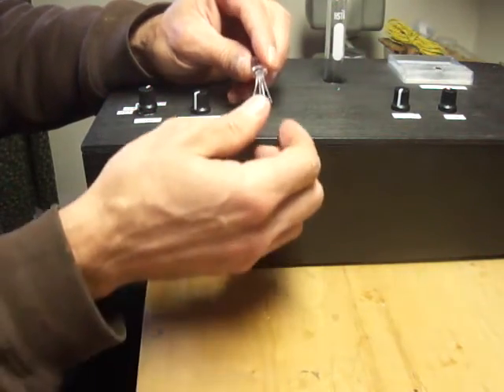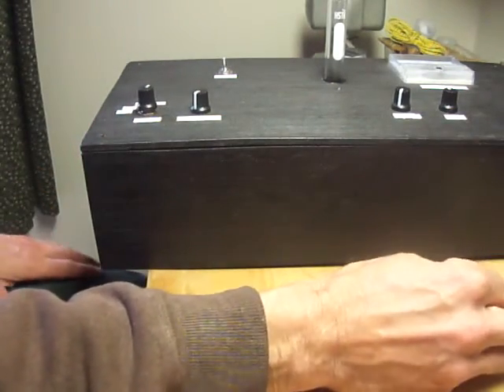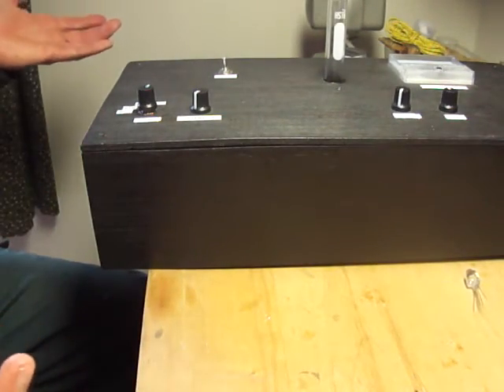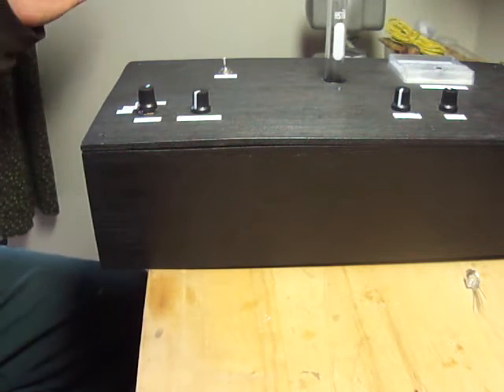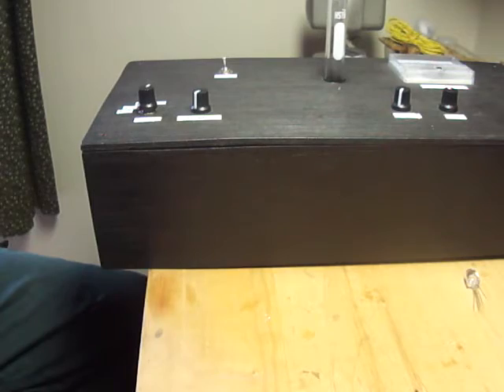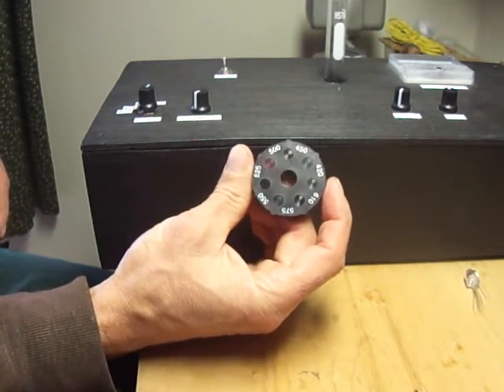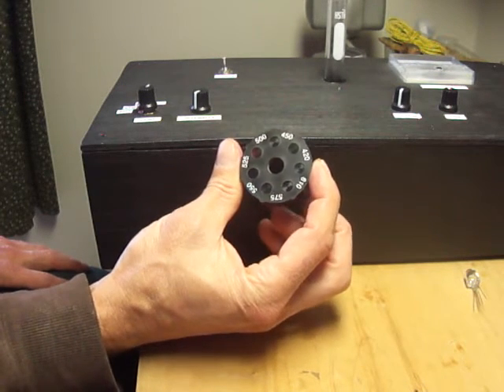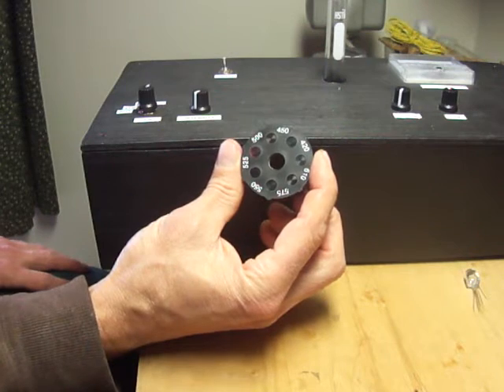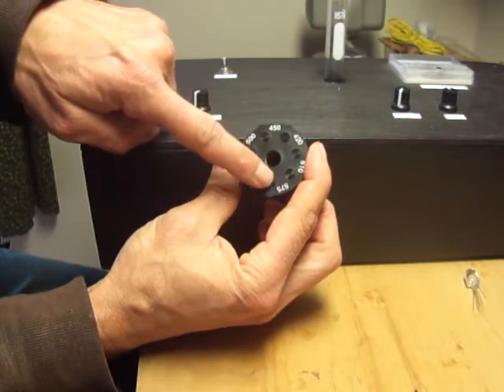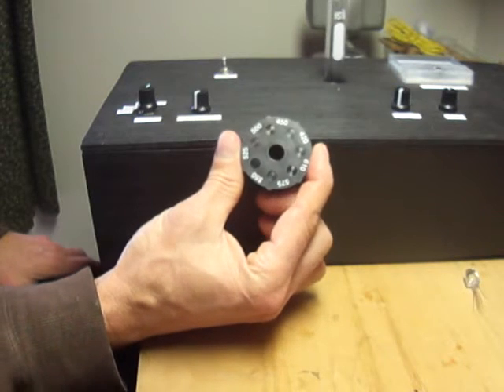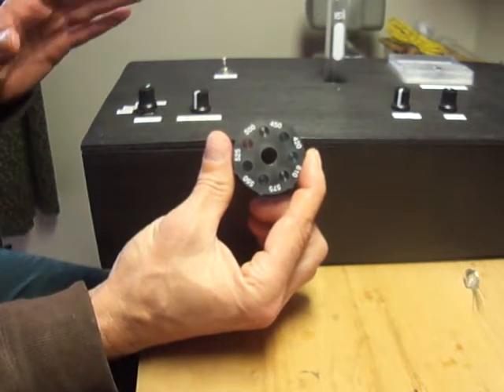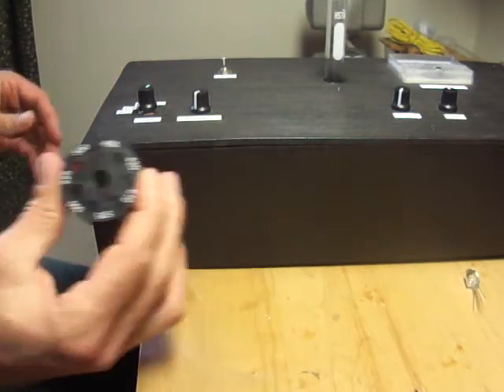I looked at some other options too and decided to go with the LED first because it was quite easy to do. But you could also put a broad spectrum source like an incandescent bulb that will give you a wide range of wavelengths throughout the visible spectrum. I saved this from eons ago from a discarded colorimeter, and you see it has different filters. You could use a broad spectrum light source and run it through the different filters. They have the wavelengths marked down here that would be appropriate for your sample. But I just thought it would be easiest to use a tri-color LED.